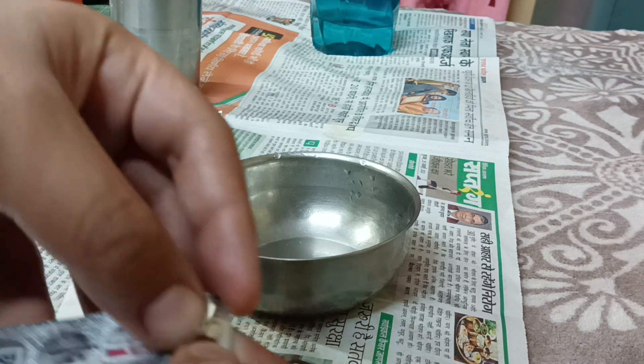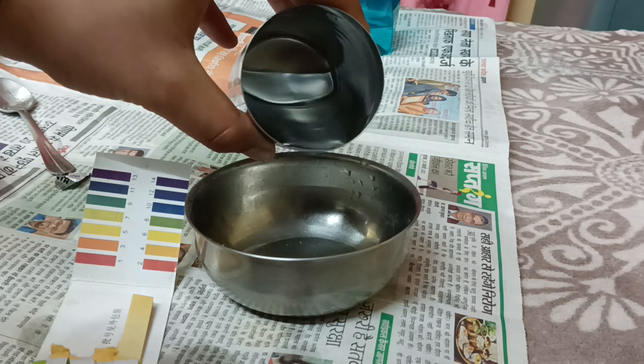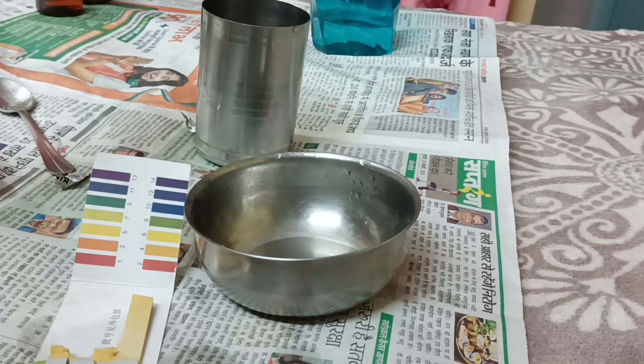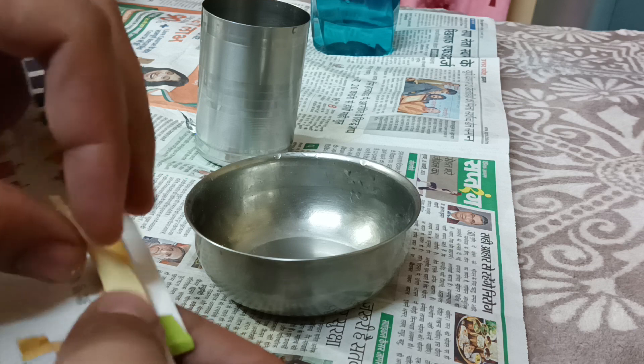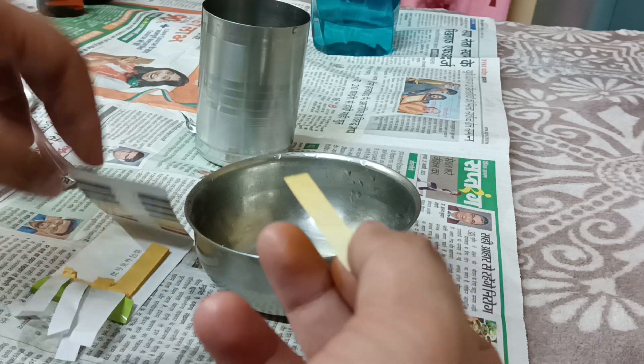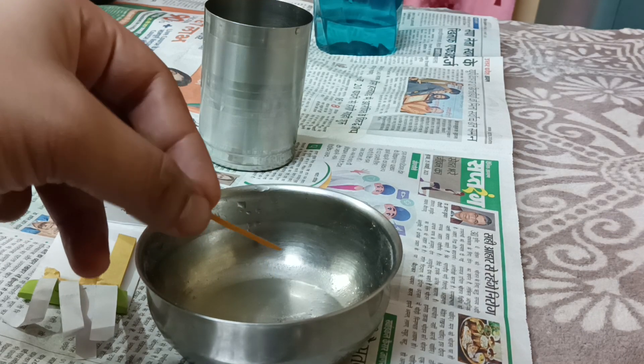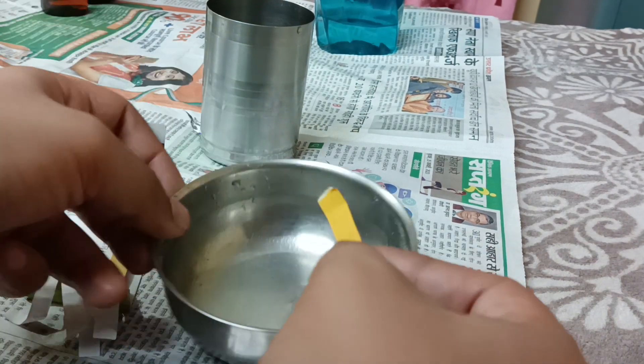I'm going to put one tablet and add just a little water in this small container. Simultaneously I'll also pull out one strip of pH paper. So the tablet is about to get mixed — it has mixed well in this small amount of water and the solution is ready.